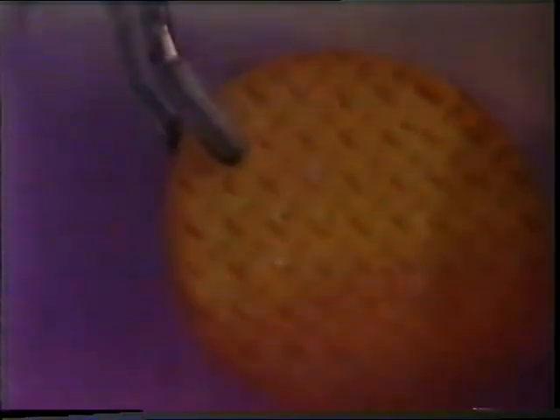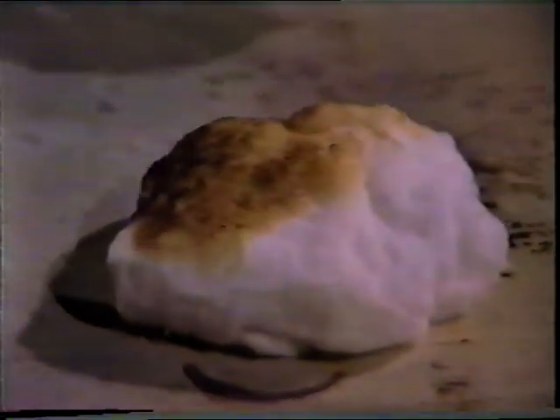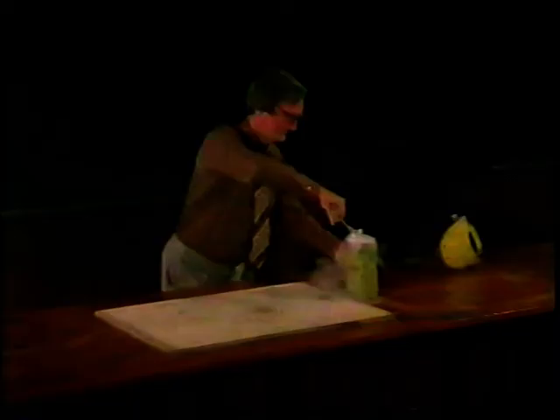This biscuit's also soaking up liquid oxygen. But don't worry about getting your biscuits too close to the fire. Biscuits don't burn very well in air because there's not a lot of oxygen there. Neither does this cotton wool — you can hardly even see the flames. But when you've been soaking another piece of cotton wool in liquid oxygen, you've got to be a bit more careful.